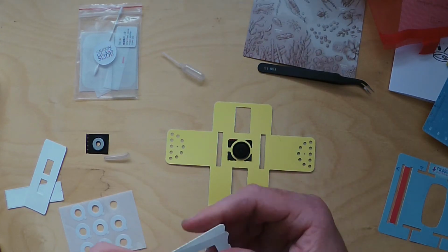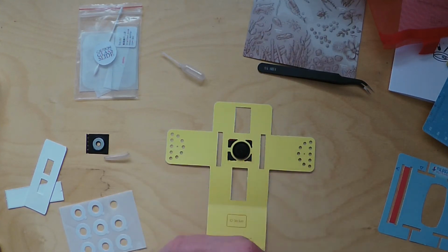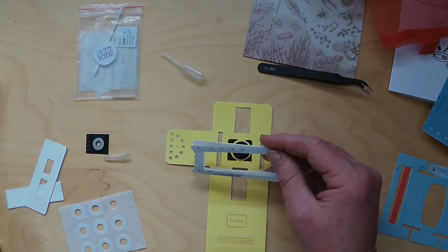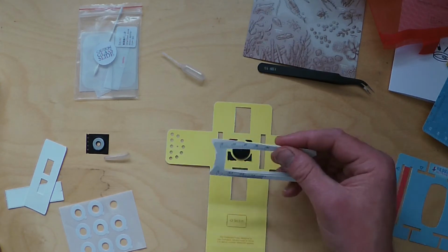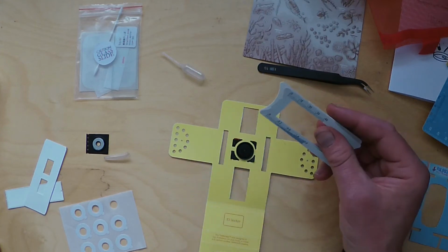So as you push this focus ramp through this kind of aperture, you're changing the distance between the slide and the lens, and that's basically how the focus works. So more on that a bit later on.